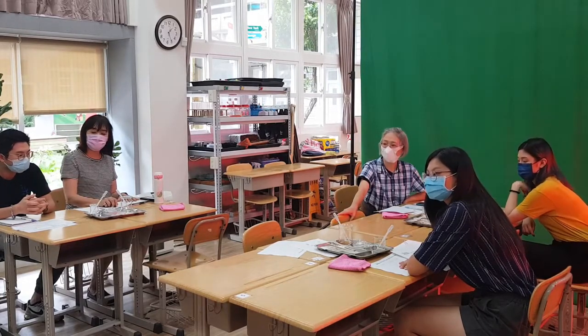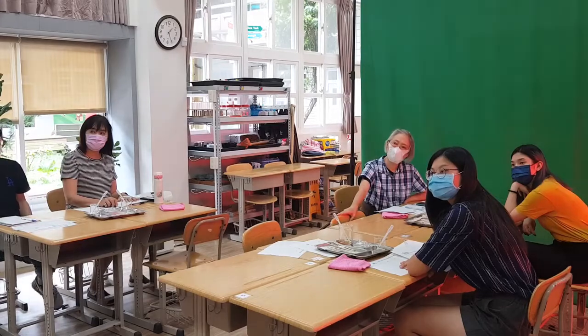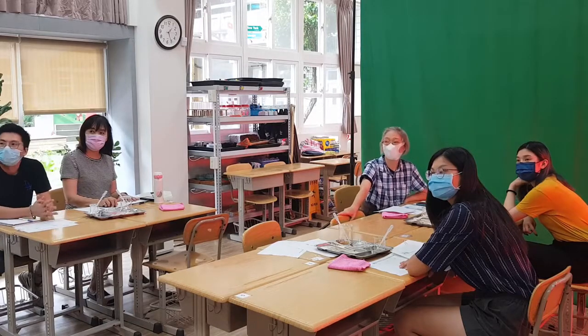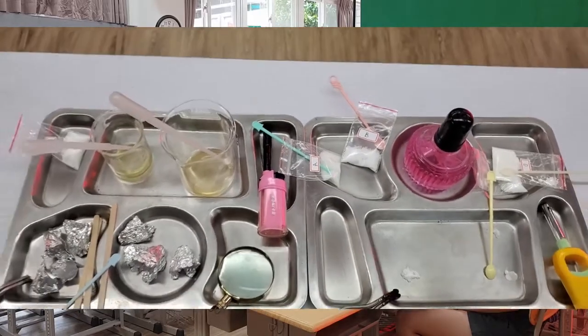same. So on my data sheet, when I write down hand lens A, B, C, D, what do I see? White. Same, same, same. But are there any little differences that you can find? I want you to go do that now. A, B, C, D. Put on your tray.